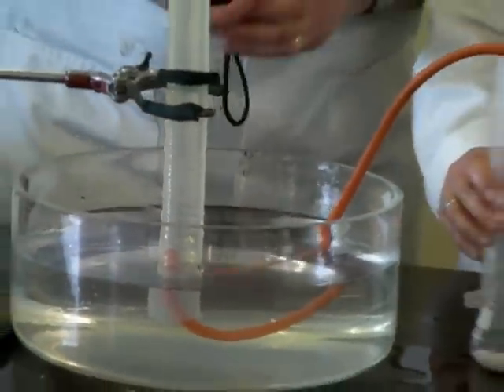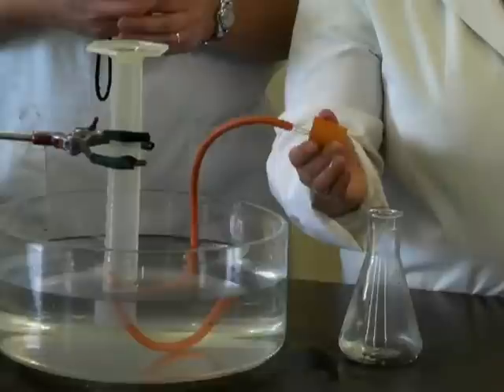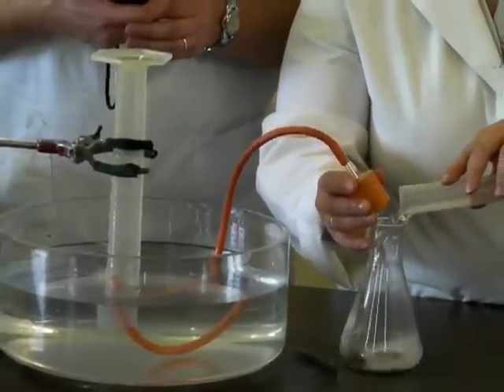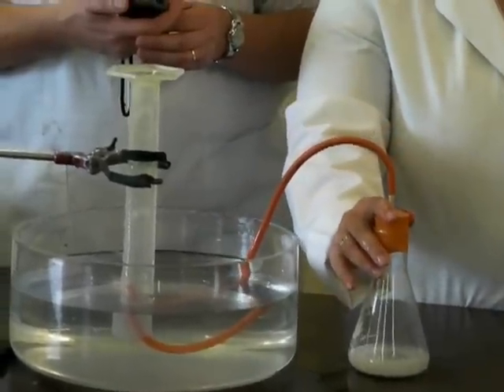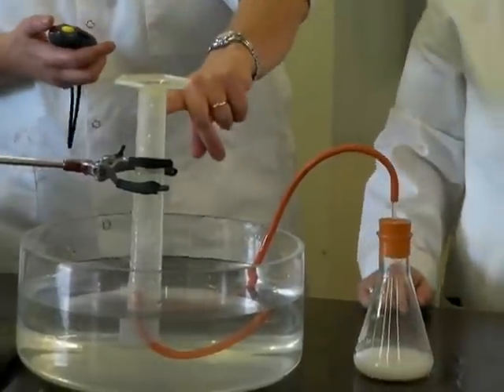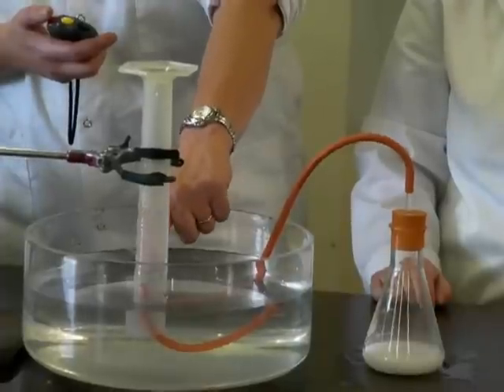Okay, we're ready, Miss Simone? We are indeed. You need to pour it in very quickly and get the rubber bung on, so it's the time from when the rubber bung goes in. 3, 2, 1, go. You see the bubbles of gas slowly filling up this tube, and we're looking for it to go to the 100 centimetre cube mark here.